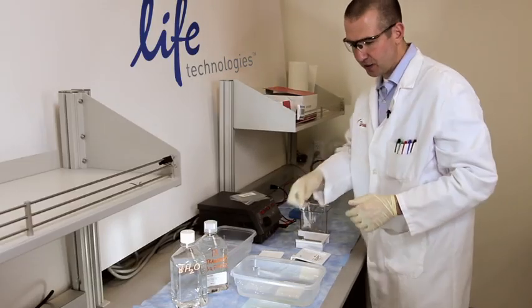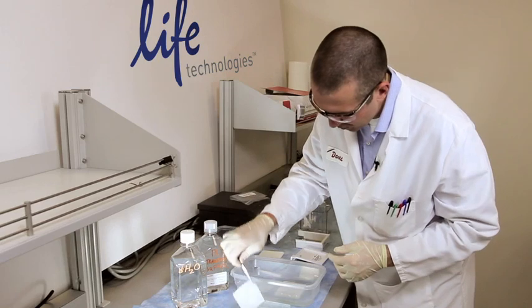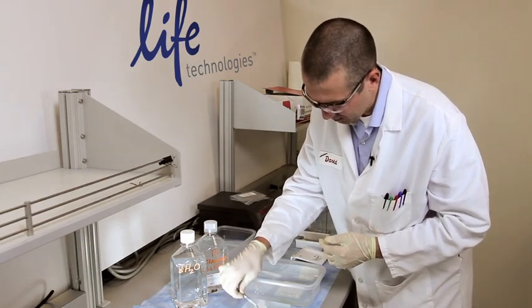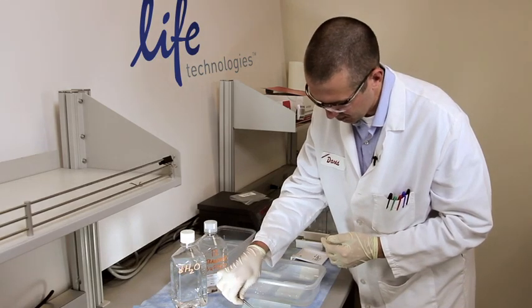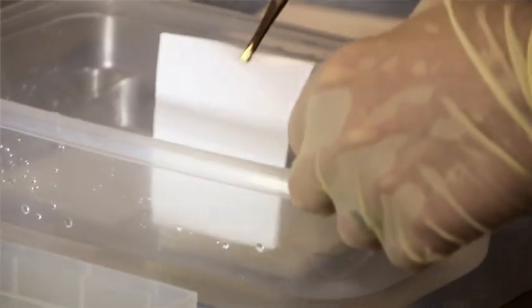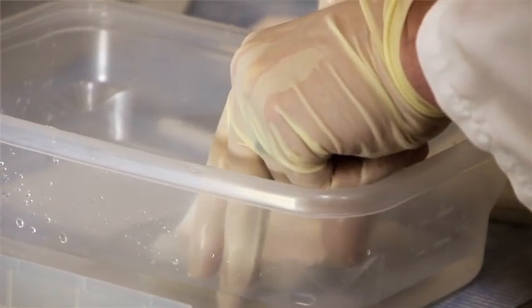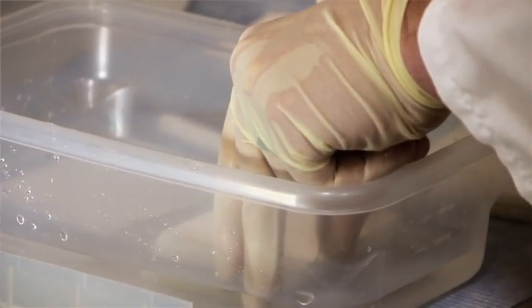Next, I'm going to carefully take the pre-wetted PVDF membrane, handling it with a pair of forceps, and then carefully lay that right on top of my NuPAGE gel.